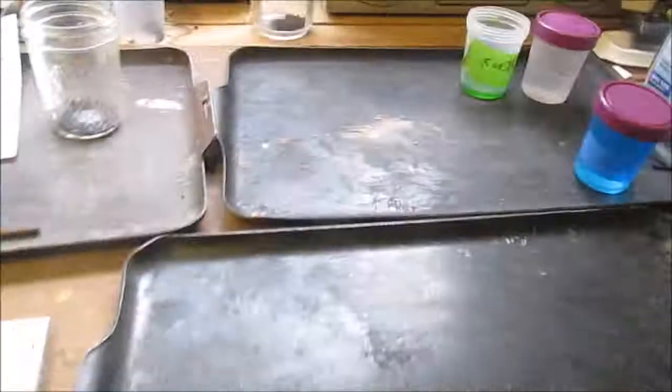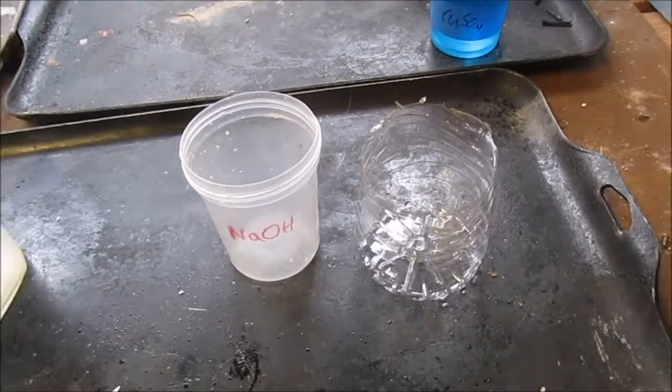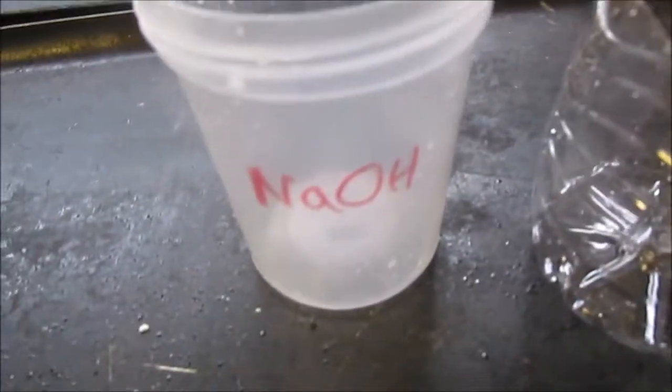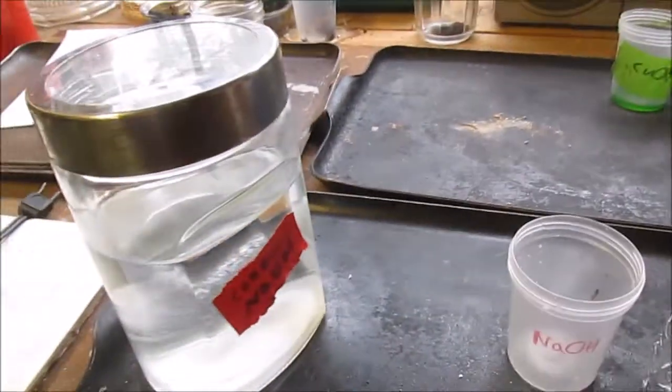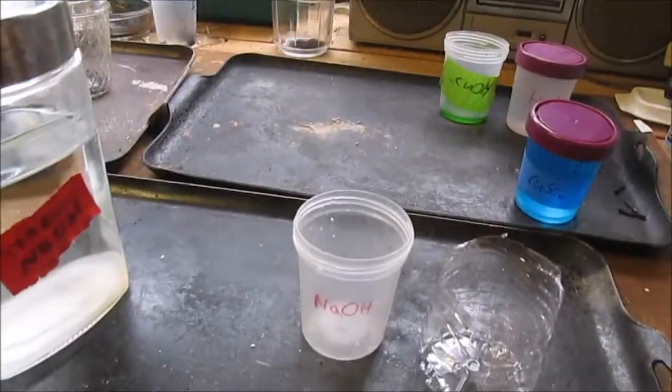Now we need to take our copper sulfate and we need to get a little bit of sodium hydroxide. So I've got some sodium hydroxide in this jar here, because what better way is there to store it than in a giant jar? Okay, so I've got two vessels here. One's for sodium hydroxide, so it's labeled as such, and then one is just a water bottle that I'm going to filter the hydroxide into.